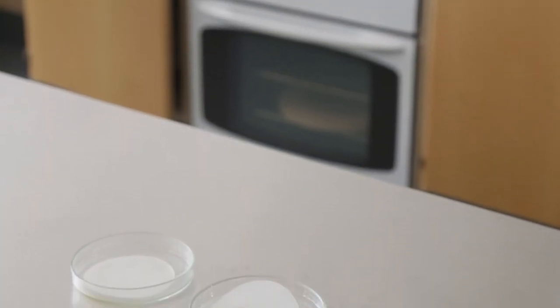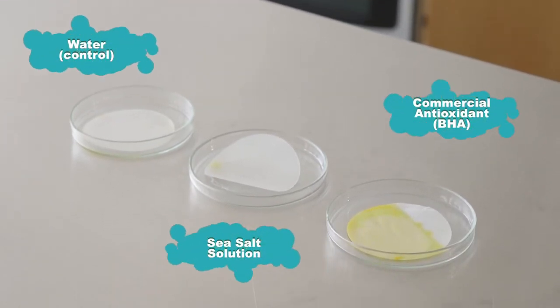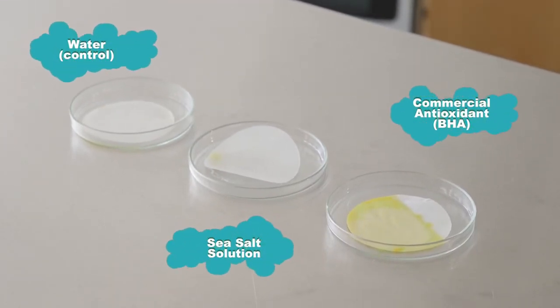Going on to the second experiment, you can see that compared with the water control, the others have faded less, due to their antioxidant activity.